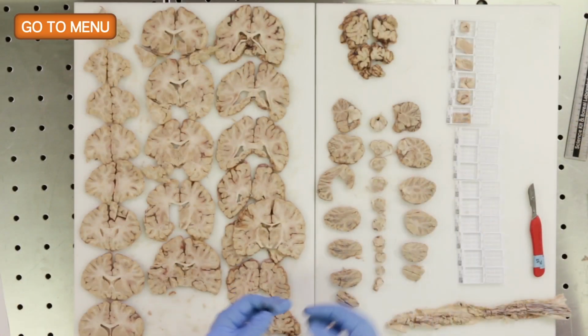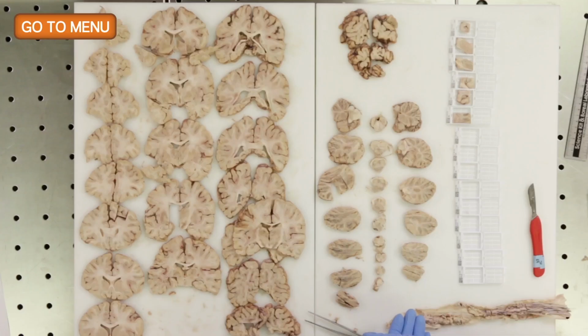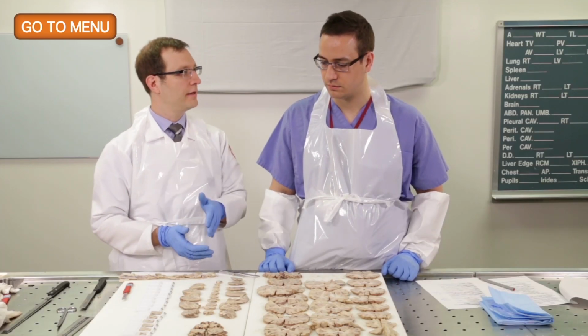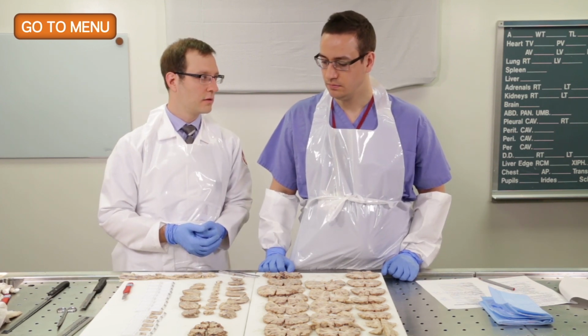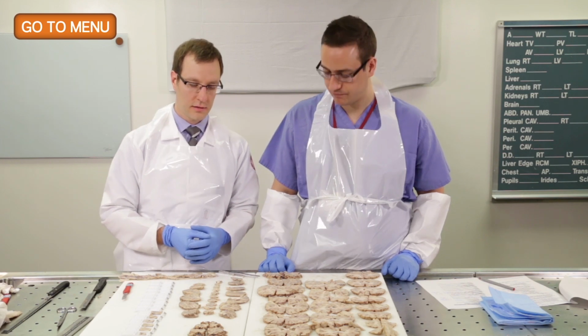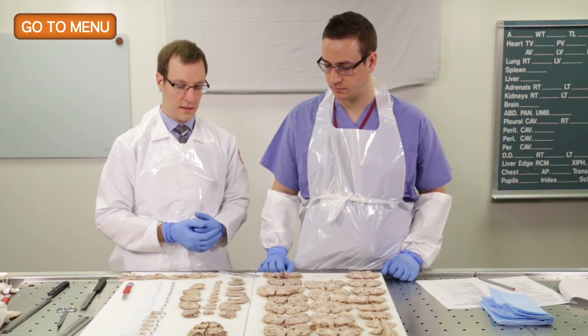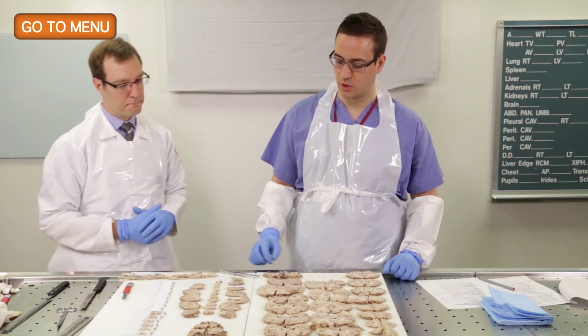Okay, so now we want to take our samples of the brainstem. So we'll take the midbrain, the pons, and the medulla. Now in this case, you want to make a notch in the section to indicate either left or right, so that when it's embedded, you can be sure which side you're looking at, because these are all symmetrical sections, and we try to fit the entire piece. So give yourself some kind of a gross indication with your knife which side is left and right, and then you make a note of that. Okay.